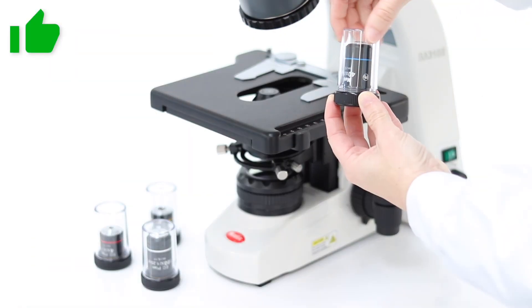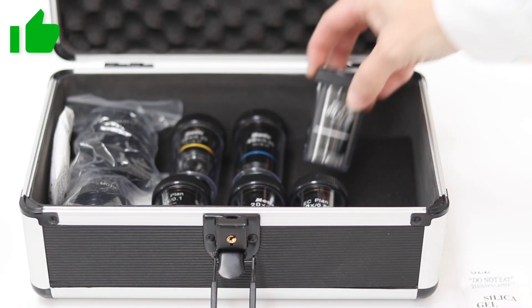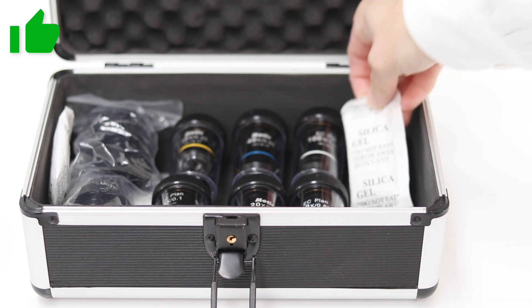When not used for a long period of time, store securely the objectives, eyepieces and filters with a drying agent.